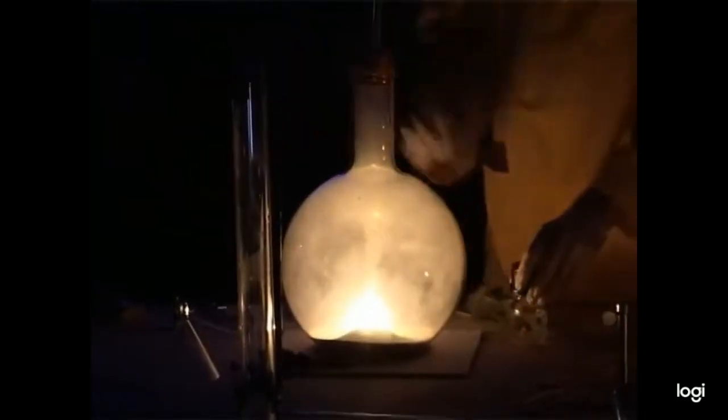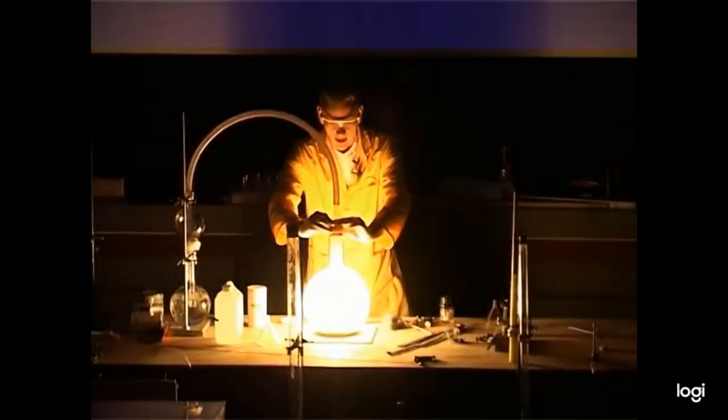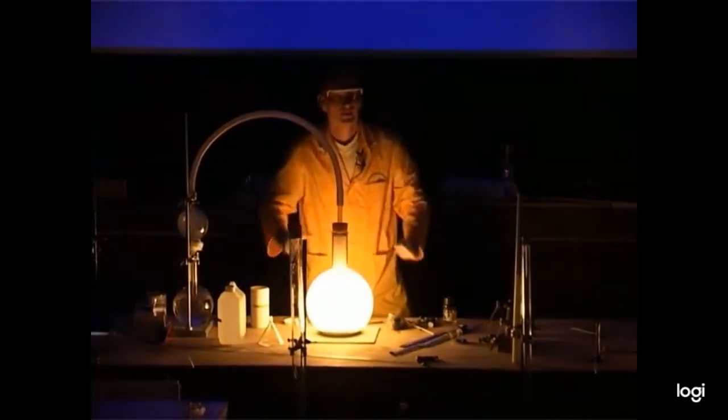So it's on the sand, and it's already caught fire. Oh, there we are. Look at that. So look at this.